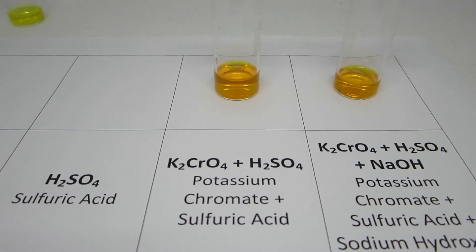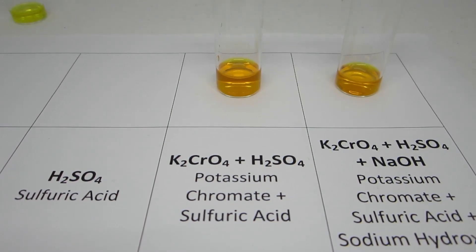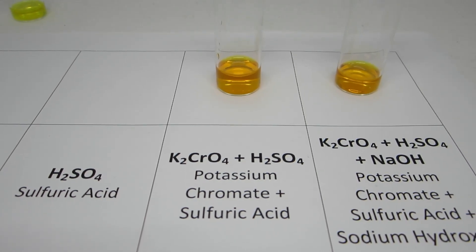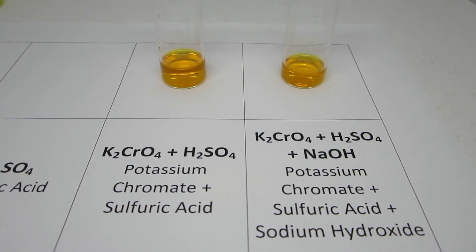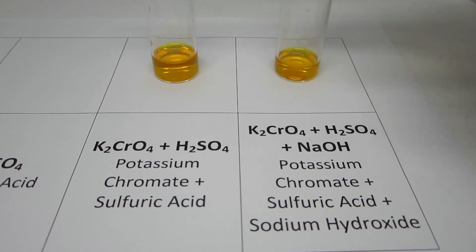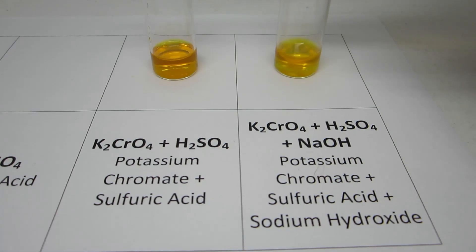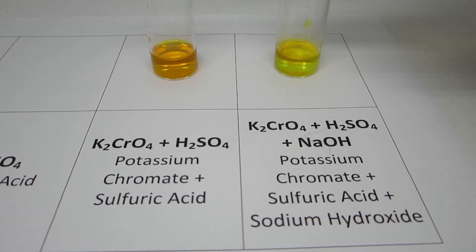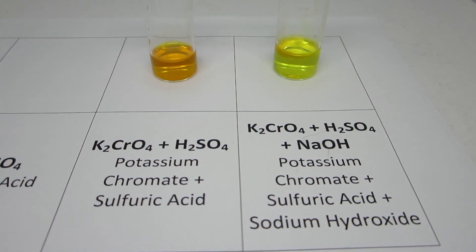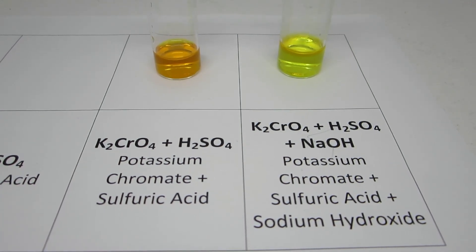The equilibrium reaction has shifted from the yellow chromate ion in the reactants to the orange dichromate ion in the products. When this equilibrium mixture is reacted with sodium hydroxide, a competing reaction occurs. This causes the solution to change color to a yellow solution, indicating that a reaction had taken place.